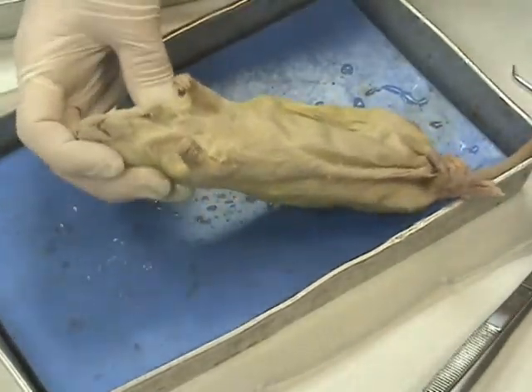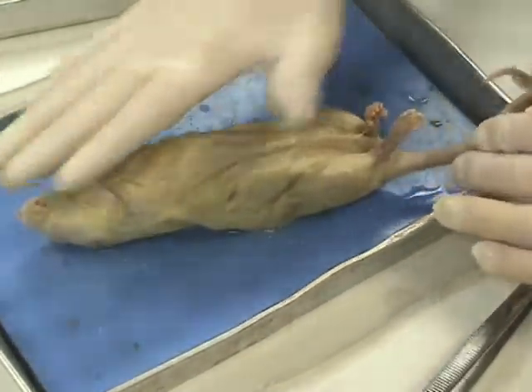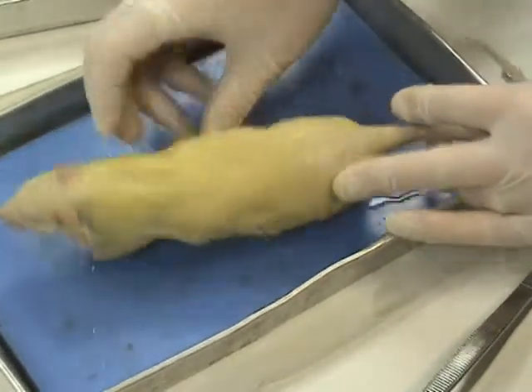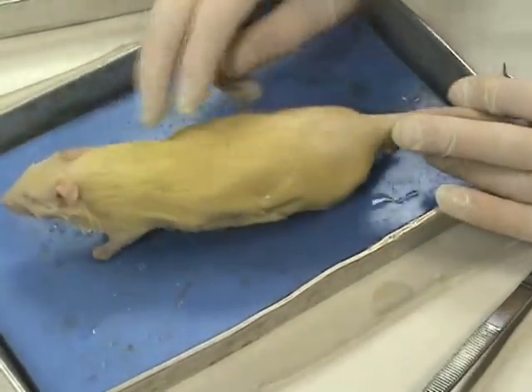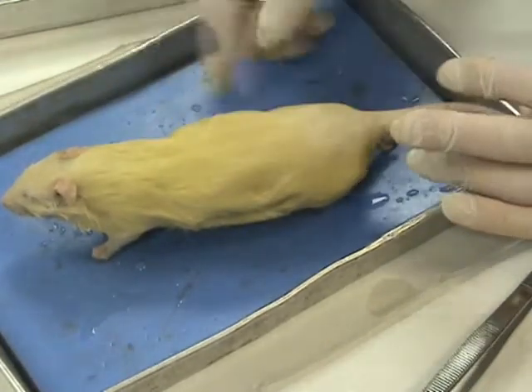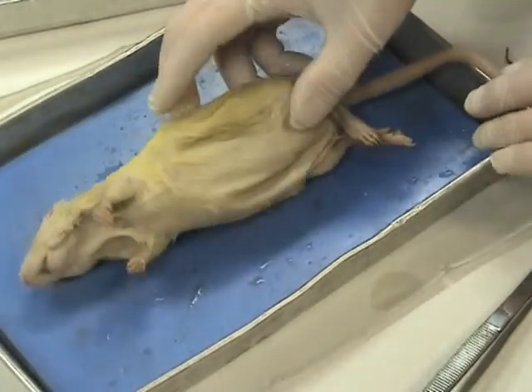We have the anterior end of the rat and the posterior end of the rat. The front side, the chest side, is called the ventral side, and the back side is called the dorsal side. Just like a shark has a dorsal fin, the back side, the dorsal side. And this allows us to give more specific directions when we actually start cutting the rat open on the next day.